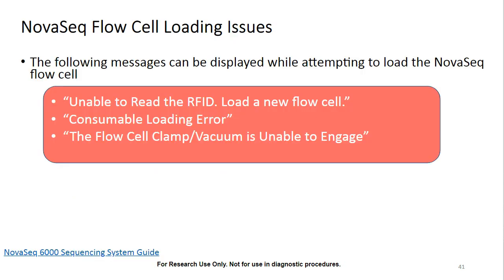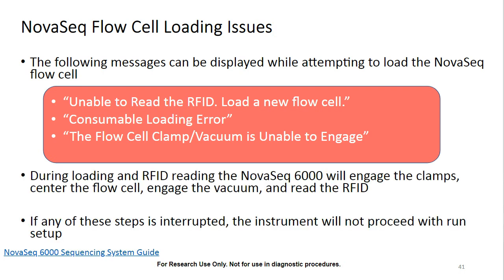Now, when we're setting up our run and we are loading our flow cells, sometimes we might encounter one of these messages where the instrument presents that it is unable to read the flow cell RFID, or there's a consumable loading error, or that the flow cell clamp or vacuum is unable to engage. So during loading and RFID reading on the NovaSeq 6000, it will first engage the clamps on the flow cell, center it, engage the vacuum, and then read the RFID. So if any of these steps are interrupted, the instrument will not be able to proceed with run setup, and it will present one or more of these messages.